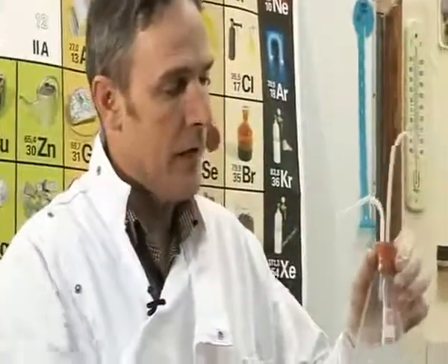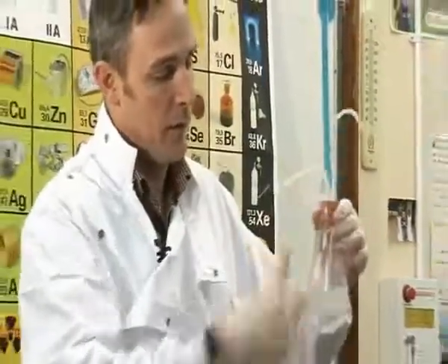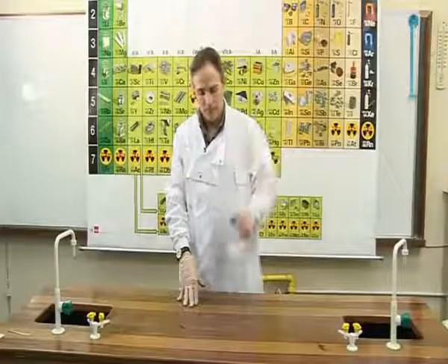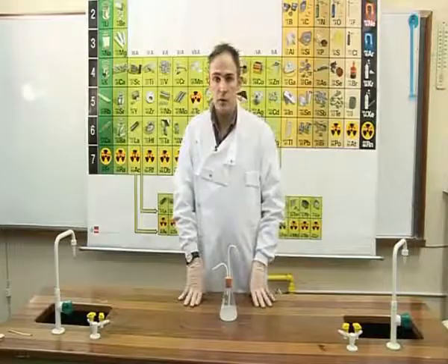After 10 minutes of inhaling through this pipe, which caused air to get drawn in through the other pipe, the lime water has changed colour from clear to milky. This indicates the presence of carbon dioxide in the air. That is the end of experiment OC22B.